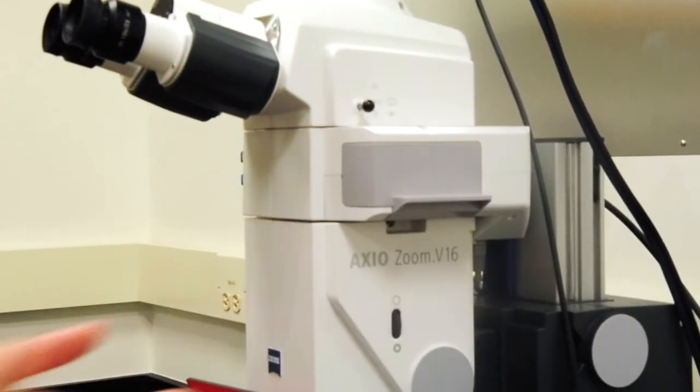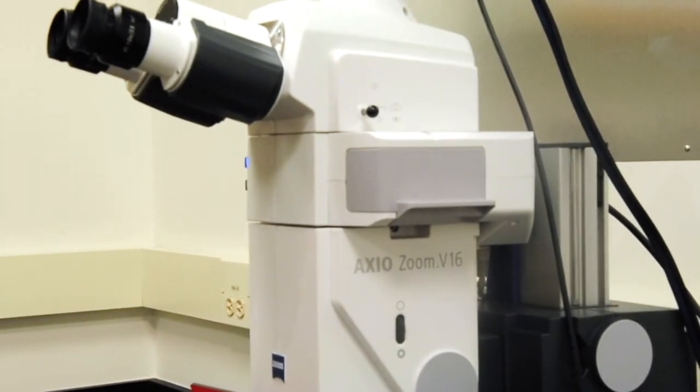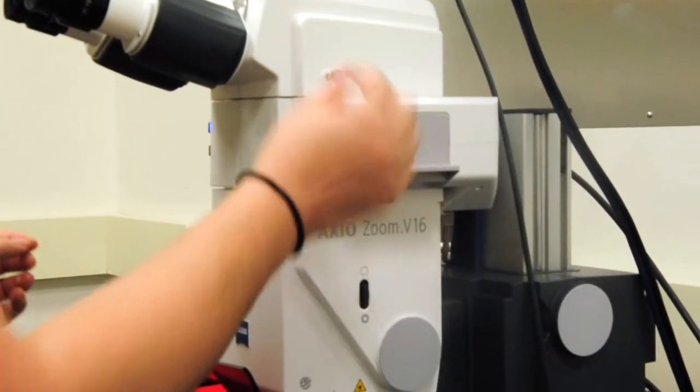And then with this particular microscope, it knows what filter cubes are there. And we'll go through and make sure that we haven't made any adjustments.